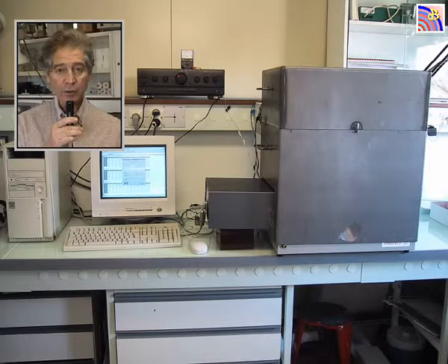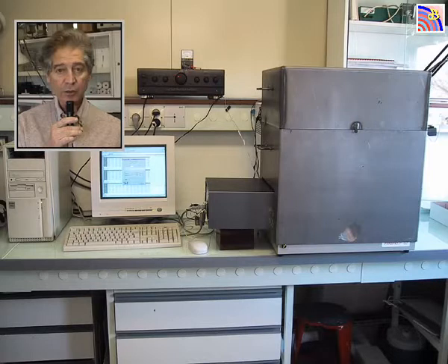On this final view, you are looking at the machine as it is in real life. It is shielded behind an iron shield that encages it completely so as to protect it from unwanted electromagnetic fields. We have two machines like that. The second one will be moved from lab to lab, and we expect to be able to buy a third one. One of them should be put in a lab in the UK, the other in the United States. We expect these experiments to be replicated in several high-level laboratories all over the world.